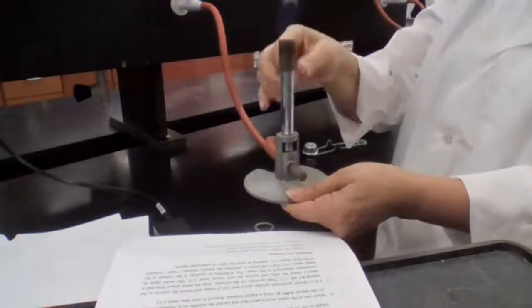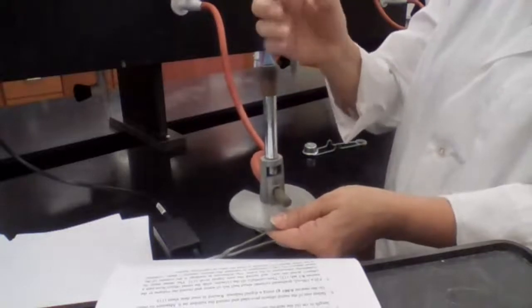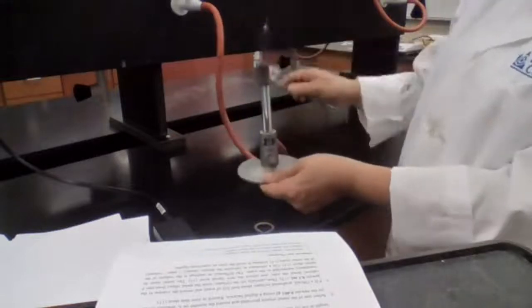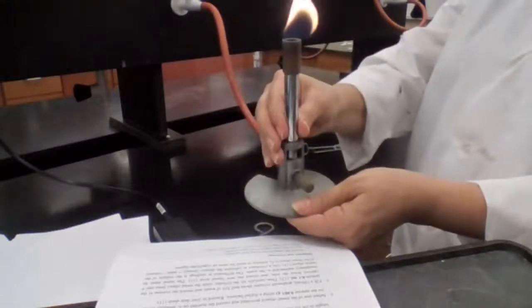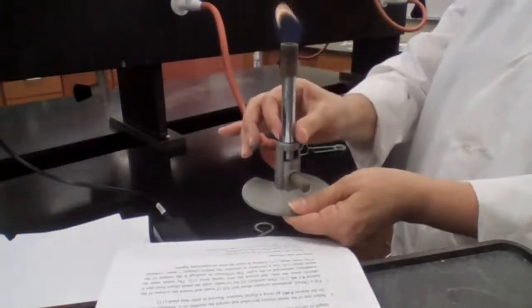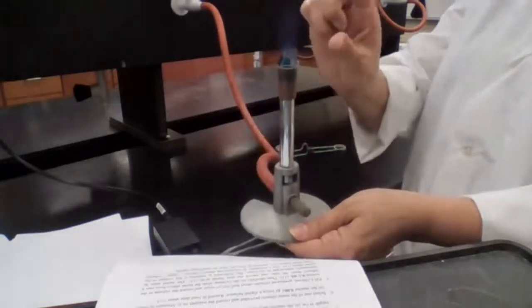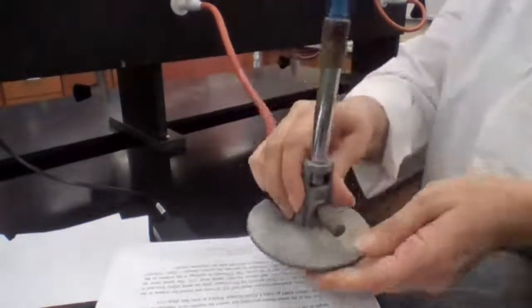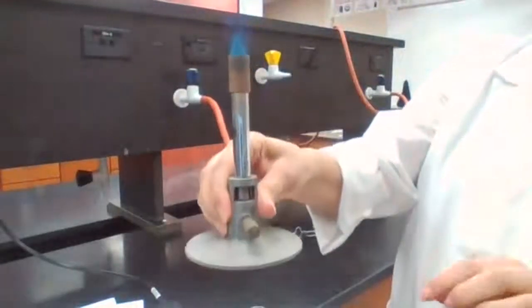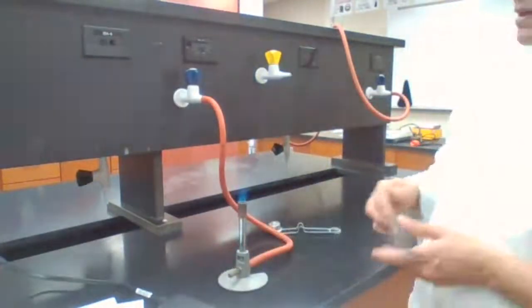From the color of the flame. If I put in too much air, it's going to start making a pop pop sound, which means be careful, it's turning off, and it did turn off. If I put in too little air, it gives me a yellow flame, and that's not what I want. So I'm going to open it, starting with the yellow flame, until it gets blue cones, 2 or 3 distinct blue cones. I don't know how many you see there, but there are 2 cones with different shades of blue. The tip of the inner cone is the hottest part of the flame.